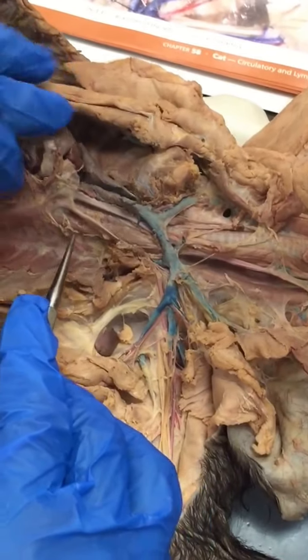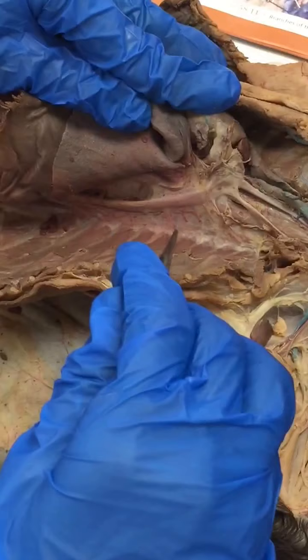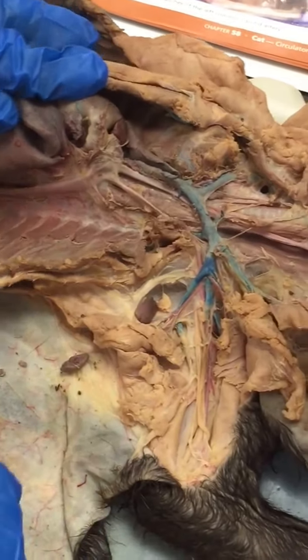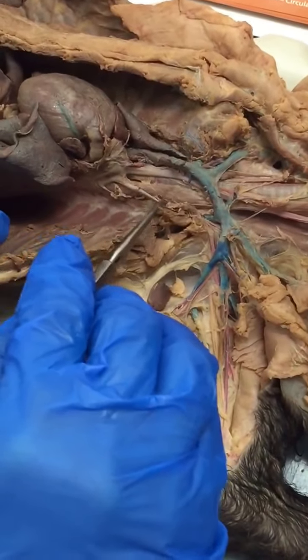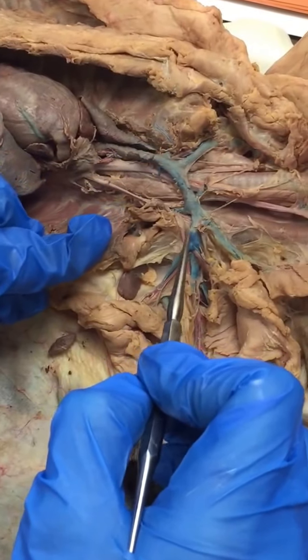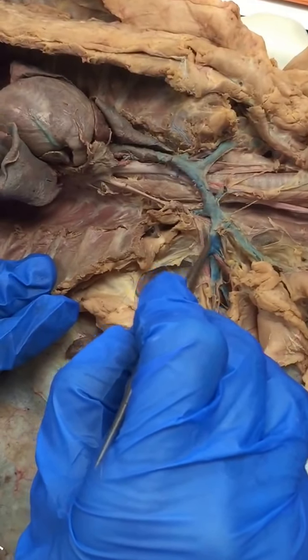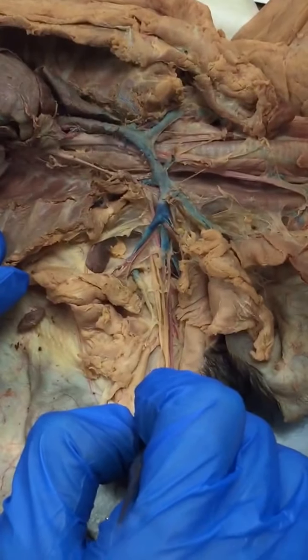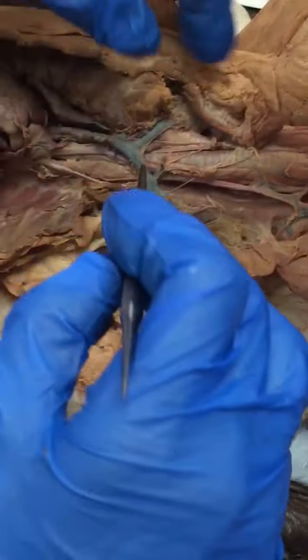Also, once you pull back the aortic arch here, you can see the dorsal aorta continues down, and you can see these intercostal arteries coming off of it going to each rib, okay? So now we're gonna follow the left subclavian artery here. It goes right to the first rib and wraps right around that. Just past that first rib, it's called the axillary artery, and then once it's on the arm here, it's called the brachial artery. So we're going to go over the different branches of the left subclavian first.